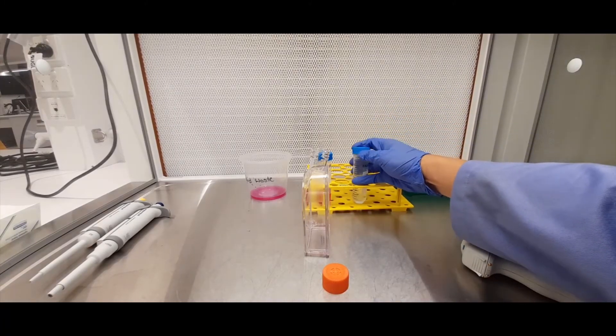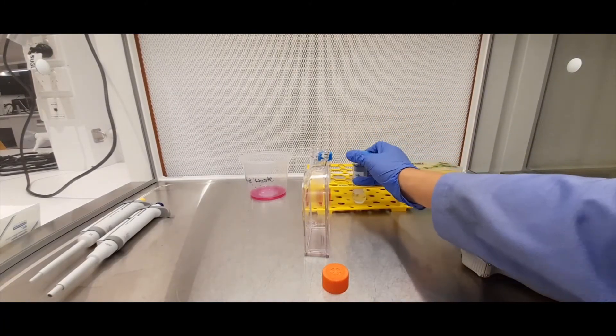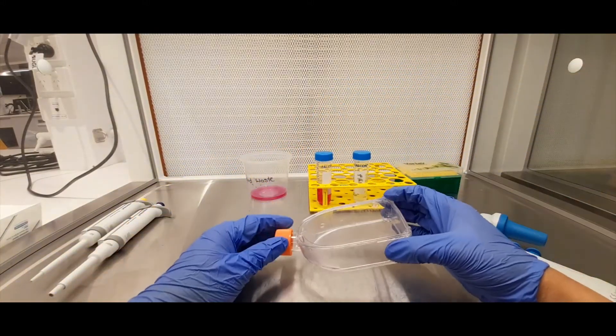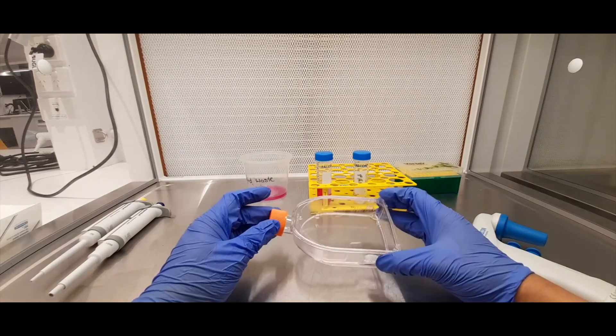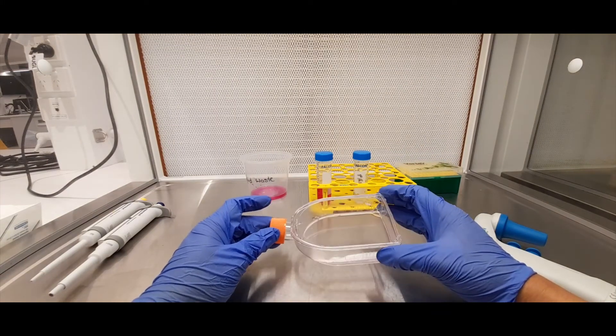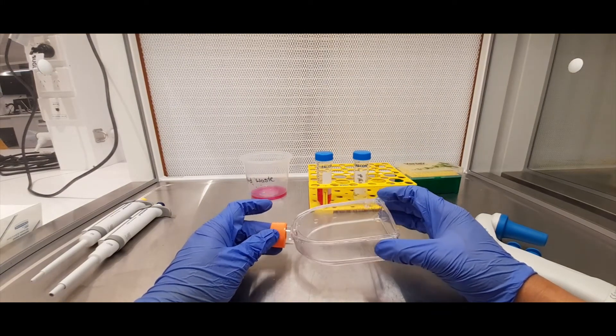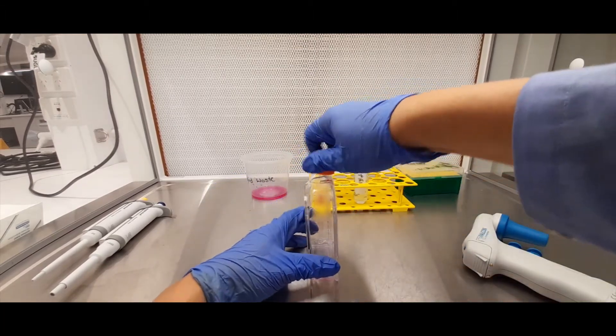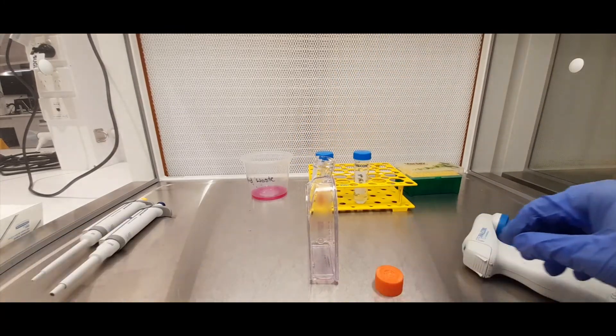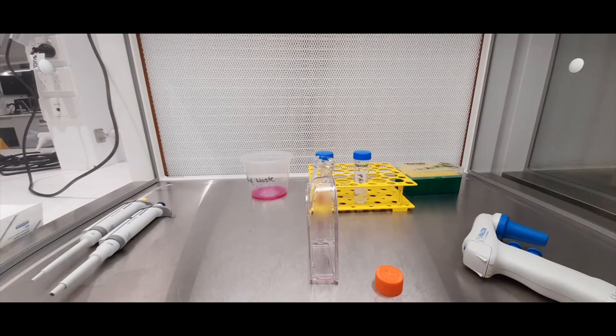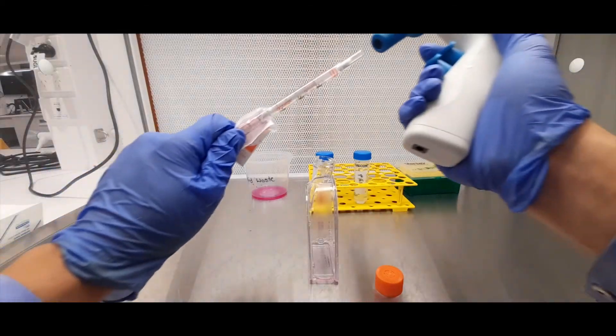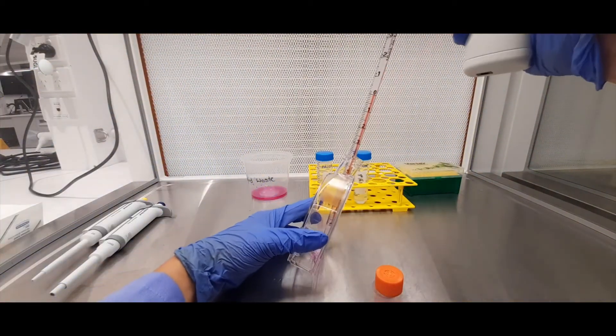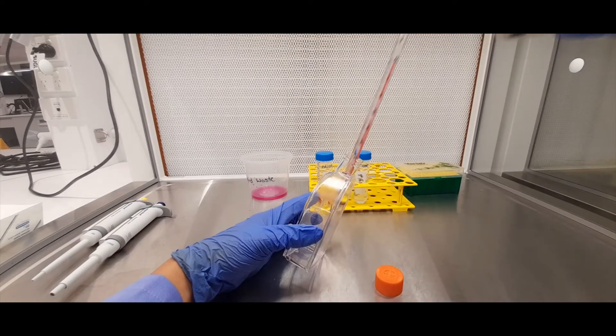So once you're done, cap that, and you want to lay that down and basically say this is a saline solution, you can wash your cells there by rocking that back and forth gently. And then to remove that saline solution, you would stand it back up again, get your new transfer pipette, sorry, a serological pipette, and we remove that saline solution.